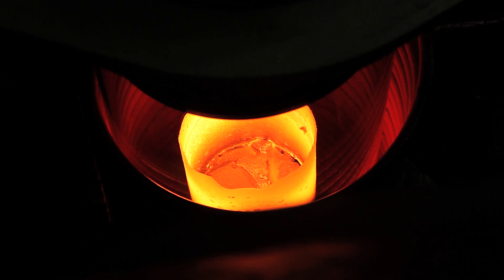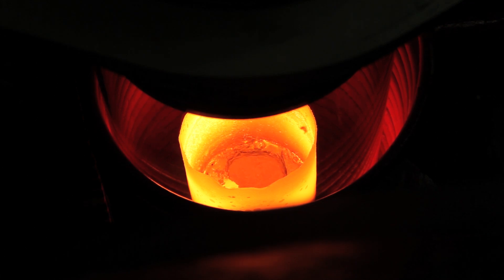The next step is to drill holes in the bottom of the crucible, quickly heat the lanthanum metal to a molten state, and then it pours out or decants out, leaving the precipitated tantalum behind.